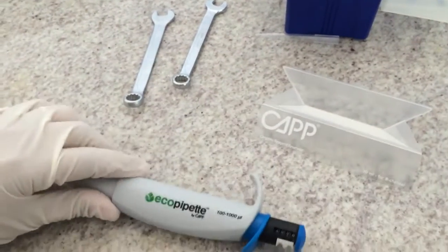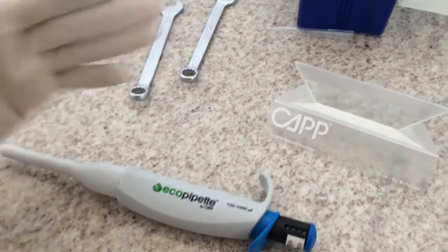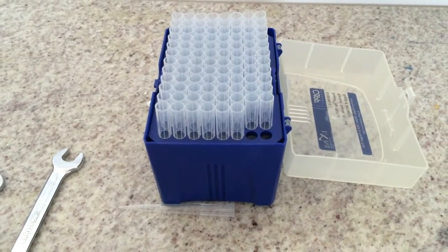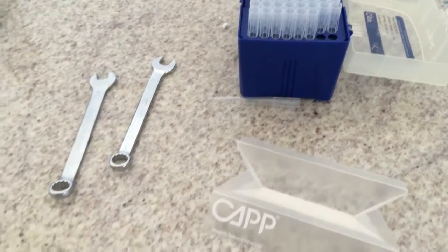If the pipette is leaking or not aspirating any liquid, you must be sure that the problem is on the pipette and not in the pipette tip being used. Test it with Capp Expel tips. If the problem continues, you may conclude that one of the sealing areas might be worn.